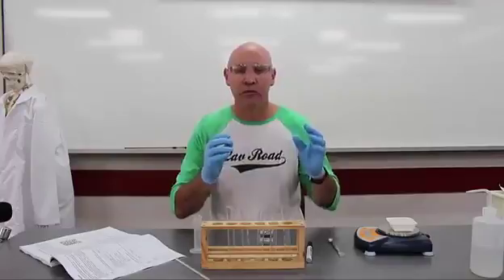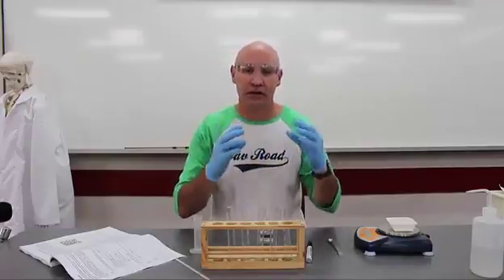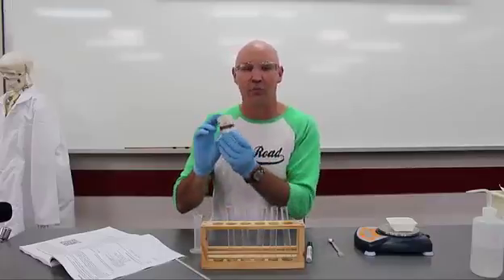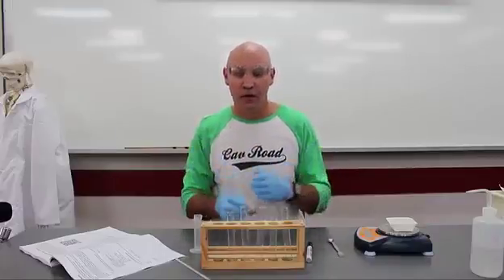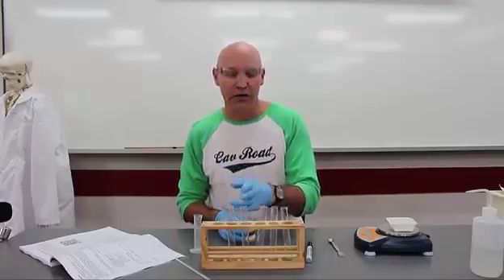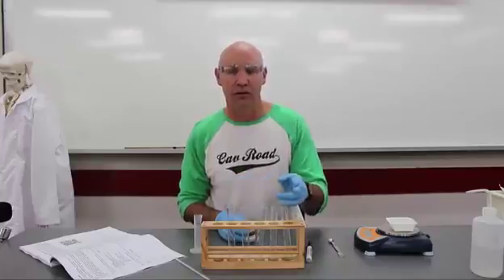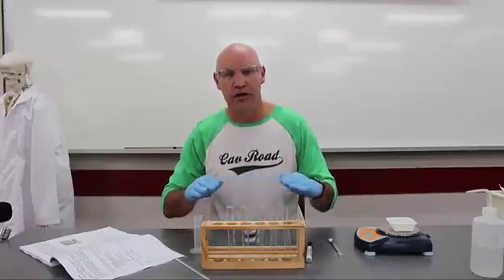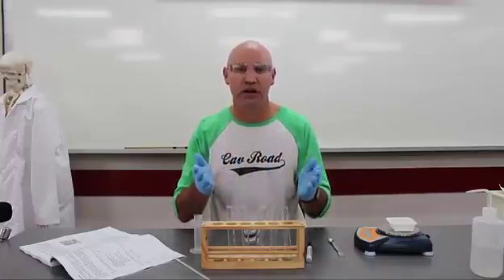The two substances we're going to use in our chemical reaction, our two reactants, are going to be ammonium nitrate and water. And we're going to look at increasing the amount of ammonium nitrate in the different test tubes and keep the amount of water the same. What you're going to measure is the change in temperature.